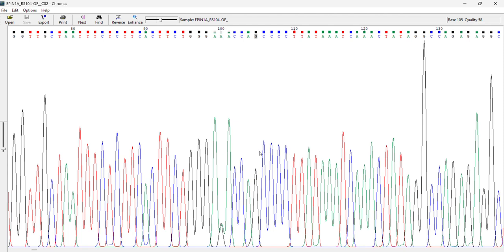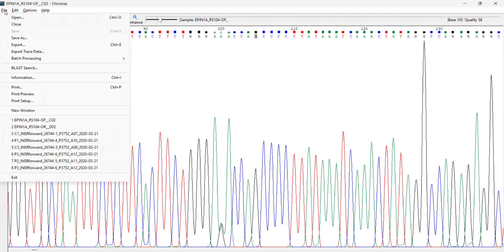Then next what we have here is you can also export it, and you can do the batch processing. For example, if I want to use or compare two different sequences at once, I can open them at once also.